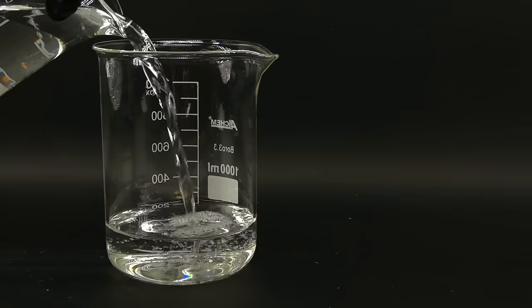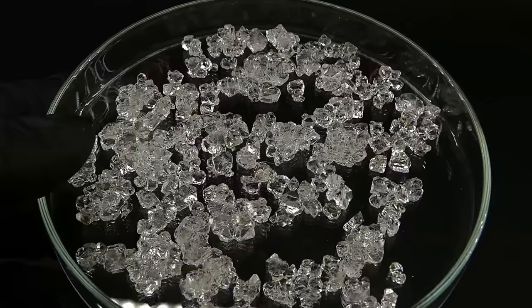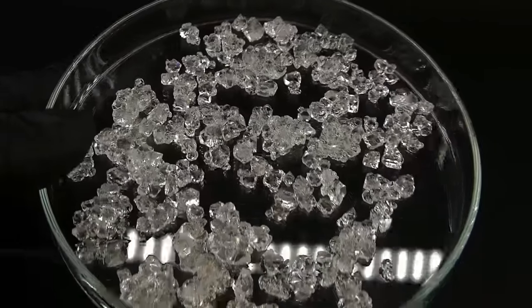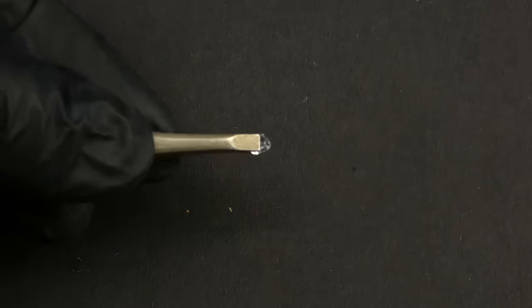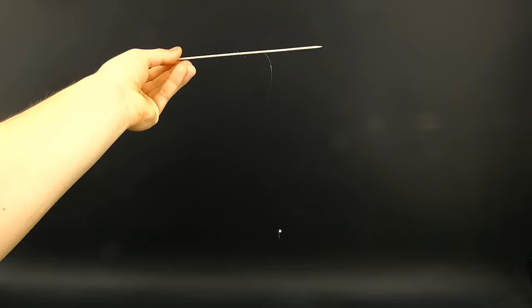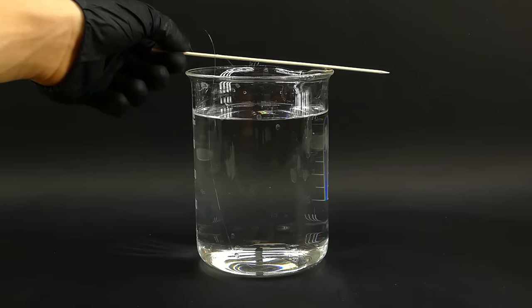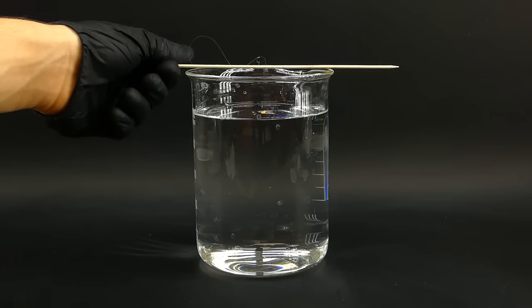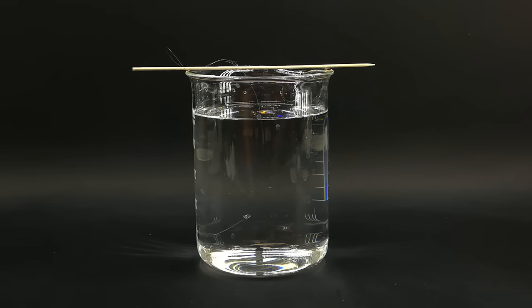I then sprinkled in a tiny amount of crushed alum and left it for 2 days. This makes the excess alum crystallize out, making the solution become perfectly saturated, which is important for growing good quality crystals. After 2 days I drained this solution into a different beaker and recovered the newly made crystals, which looked incredibly nice by themselves. And to grow a big one I picked a single nice looking crystal to use as a seed and tied it to a fishing line, which I secured in the solution using a small stick.